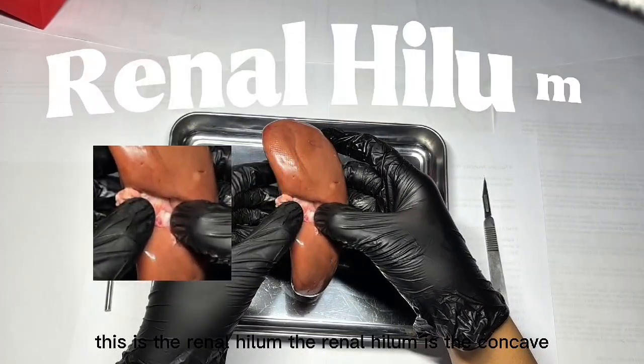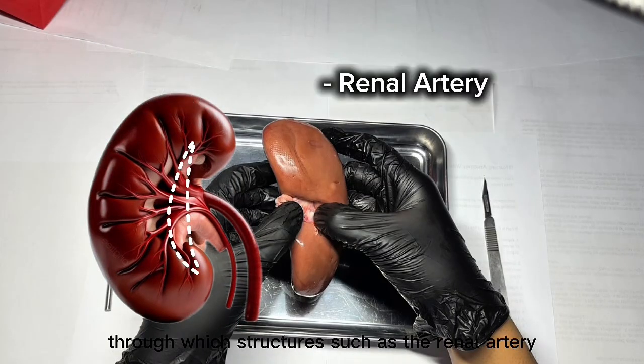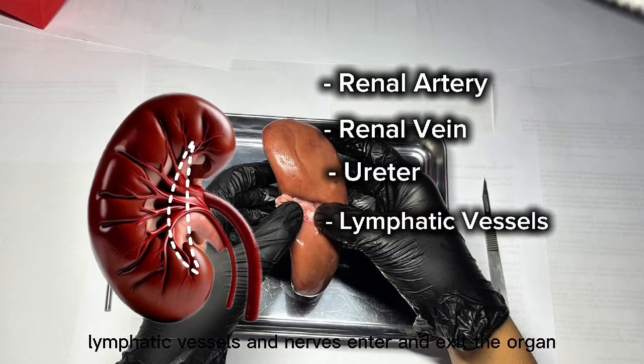This is the renal hilum. The renal hilum is the concave medial indentation of the kidney through which structures such as the renal artery, renal vein, ureter, lymphatic vessels, and nerves enter and exit the organ.